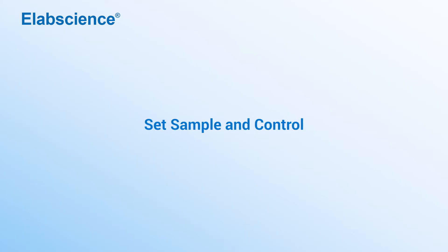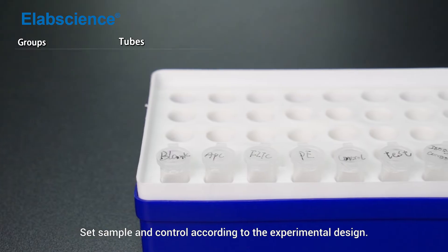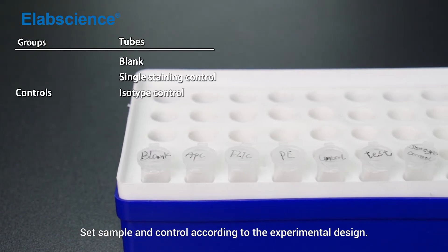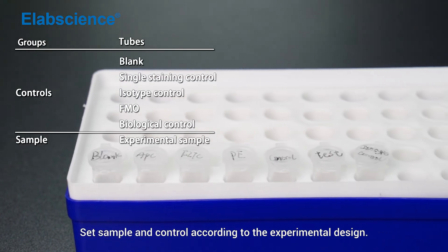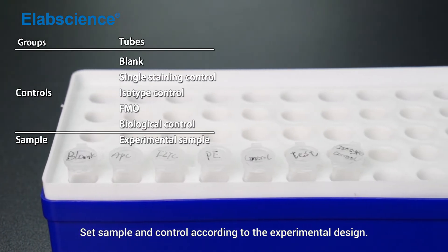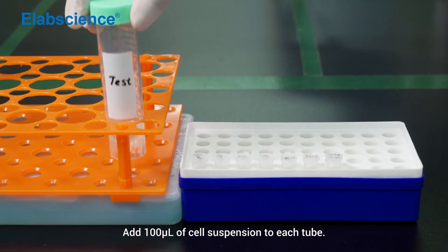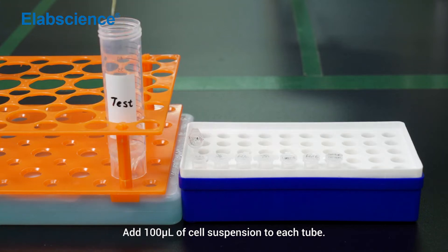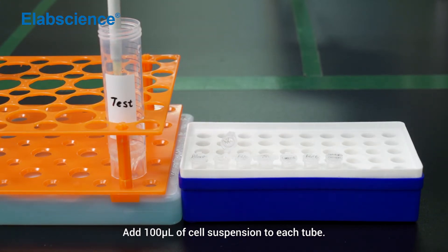Set sample and control according to the experimental design. Add 100 µL of cell suspension to each tube.